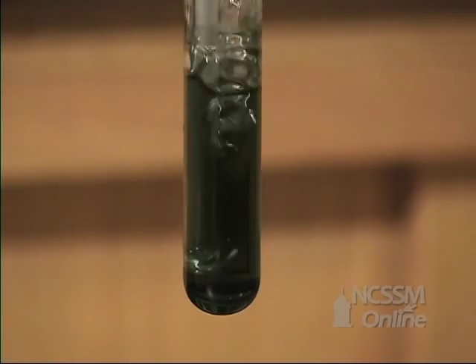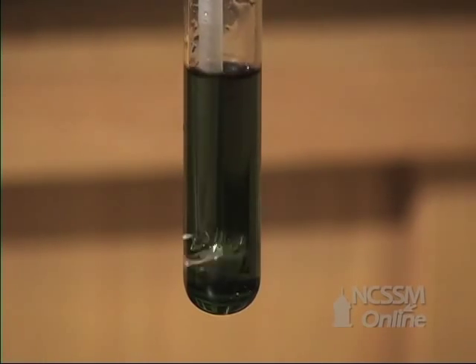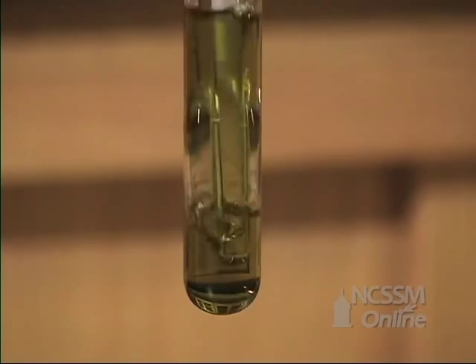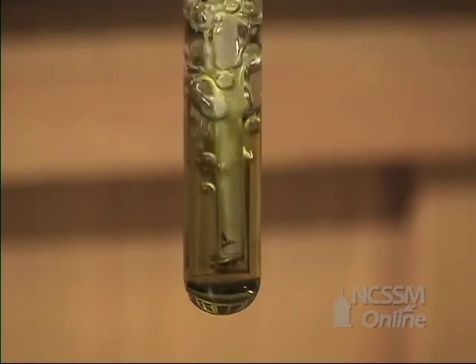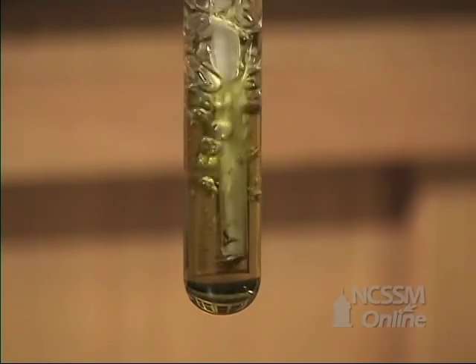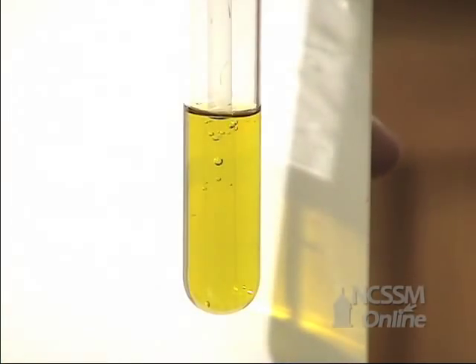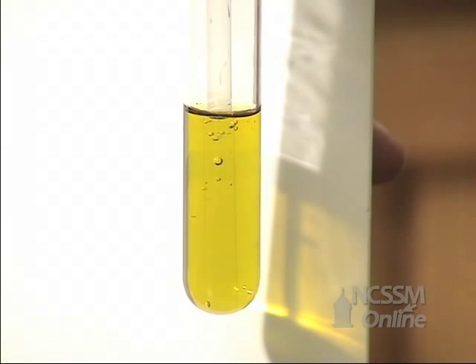In order to actually see the change, we will add some bromothymol blue to the solution. The bromothymol blue is blue in neutral solution and turns yellow in acidic solution.